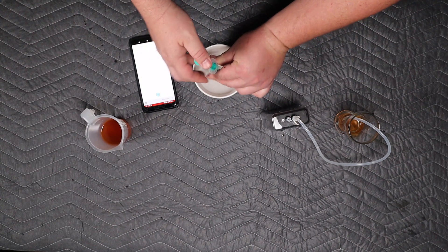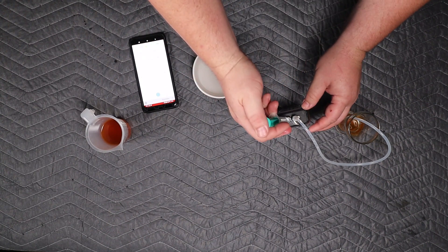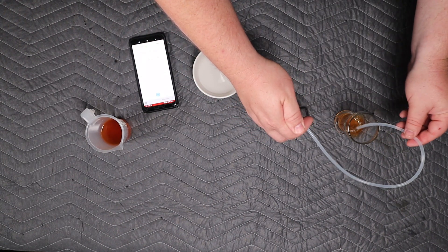And then when you're done with this guy, you basically take some warm distilled water, your sanitized syringe or whatever without a needle, push it through a few times, and it's good to go.